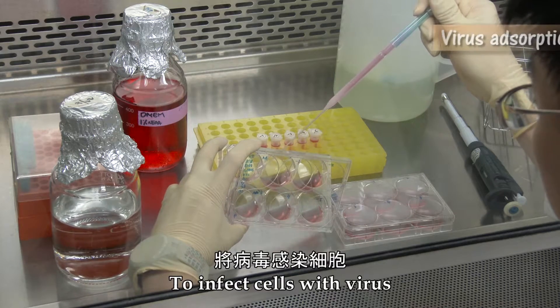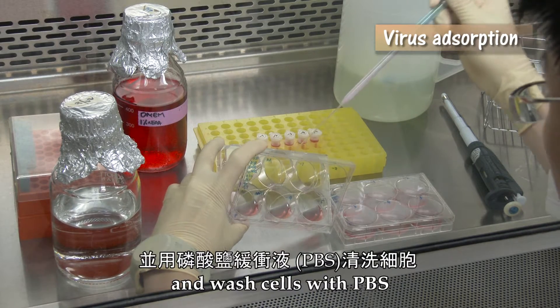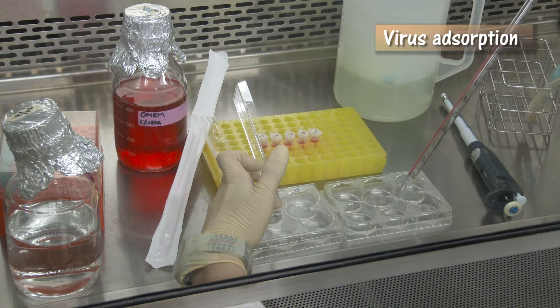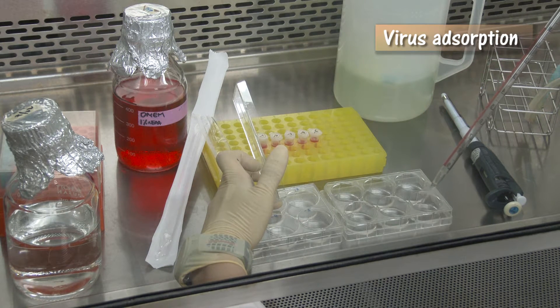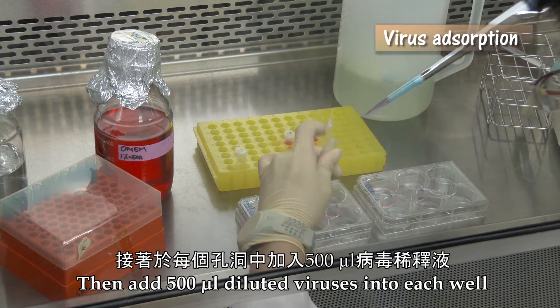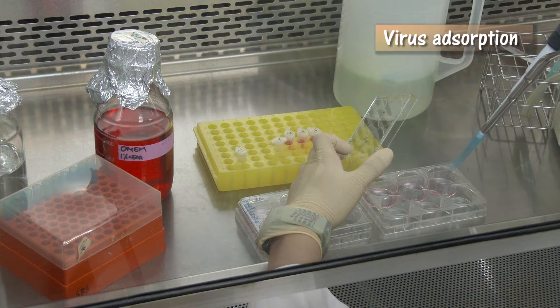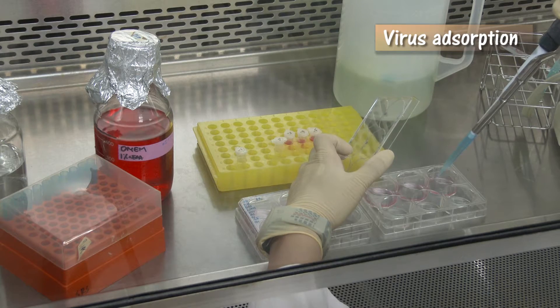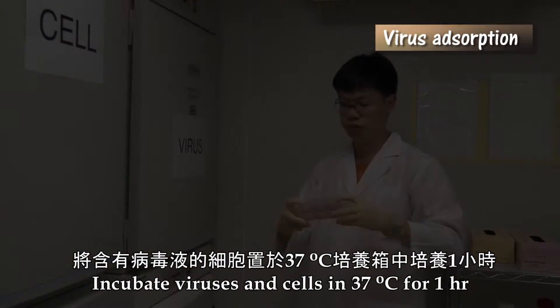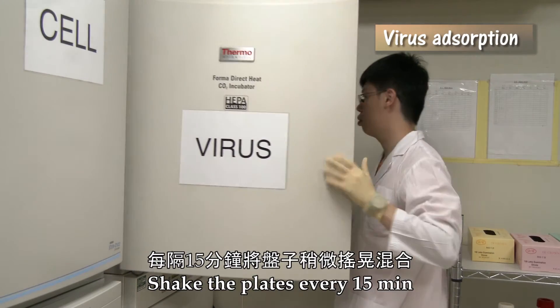To infect cells with virus, discard medium from each well and wash cells with PBS. Then add 500 microliters of diluted virus into each well. Incubate viruses and cells at 37 degrees Celsius for one hour. Shake the plates every 15 minutes.